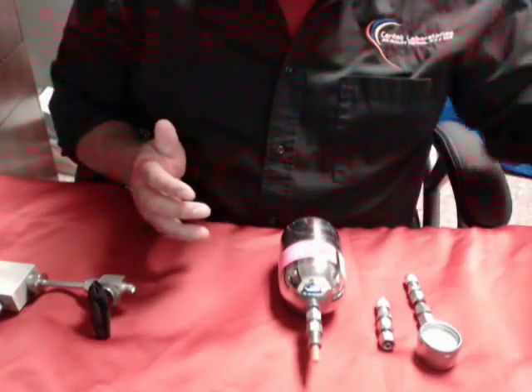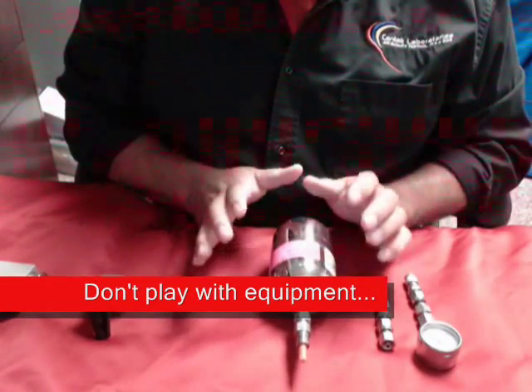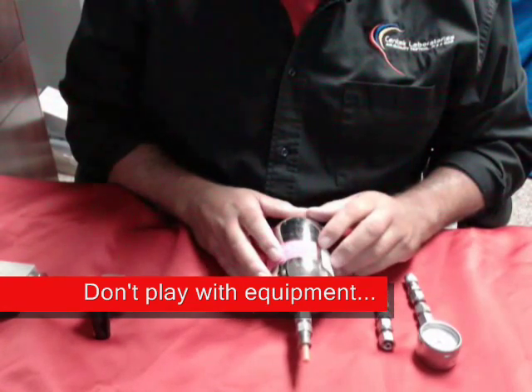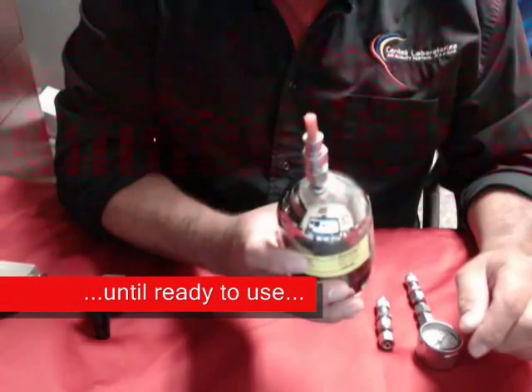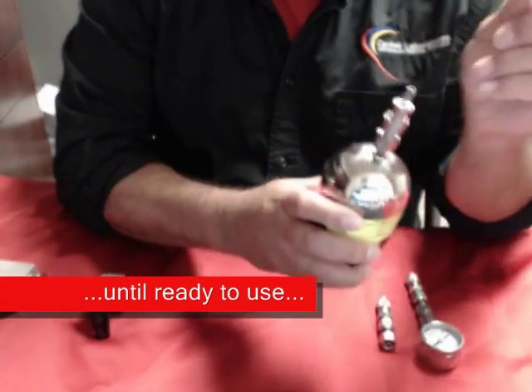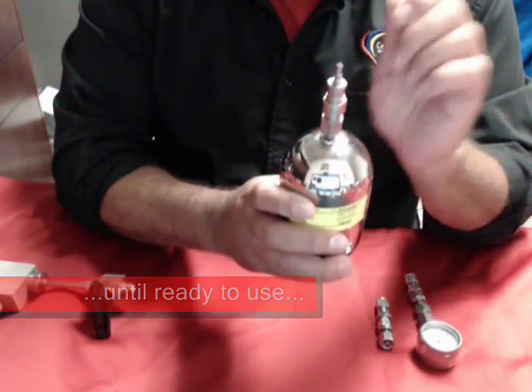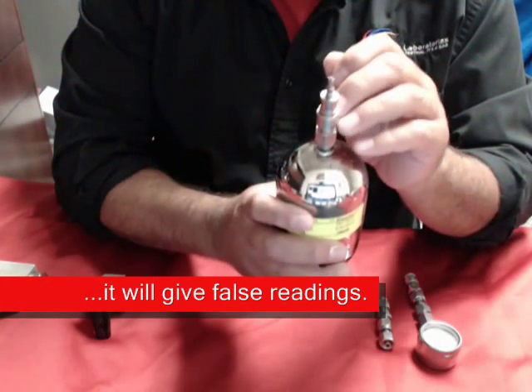It's very important to understand that once you get this equipment, it's a one shot and you're done. Do not play with the equipment prior to taking your sample. If you notice on the canister, there will be an orange tip — this is a protective cap. When we take this protective cap off, there is a set of crosshairs. If the crosshairs are pushed in and disengaged before you start to take your sample, you're going to bias your results.